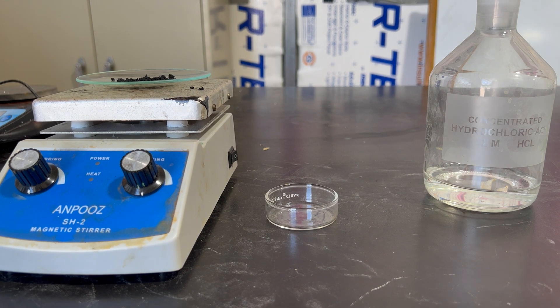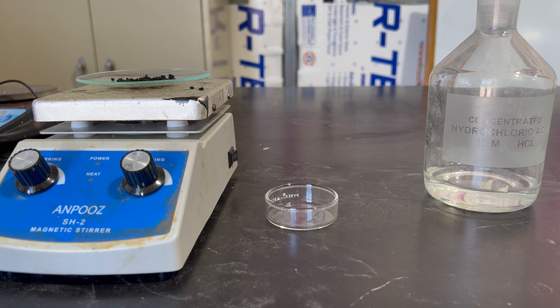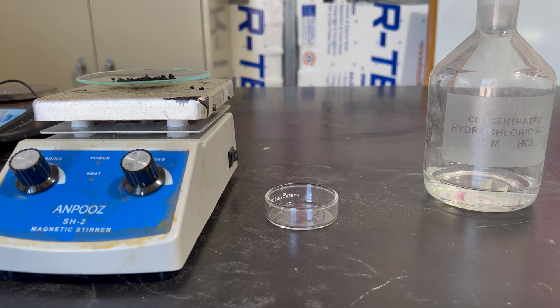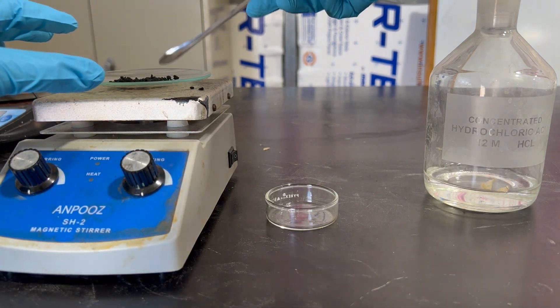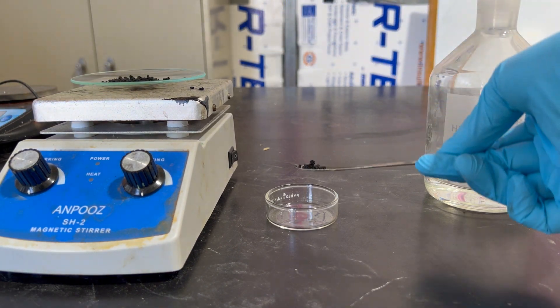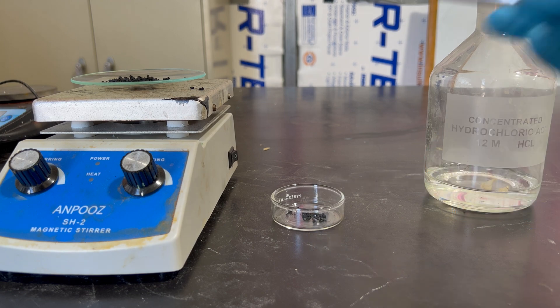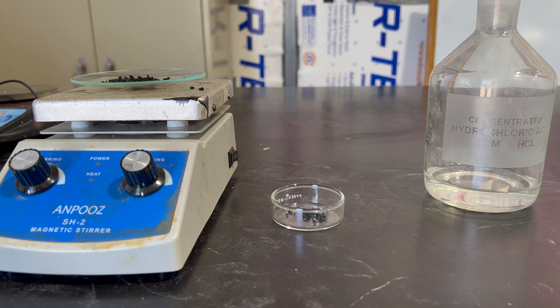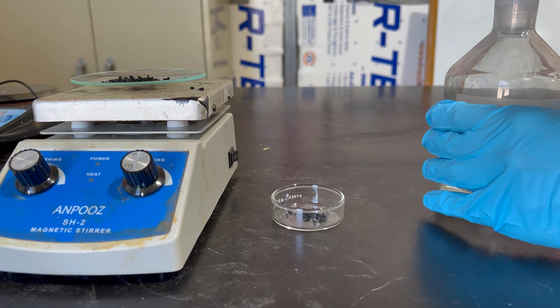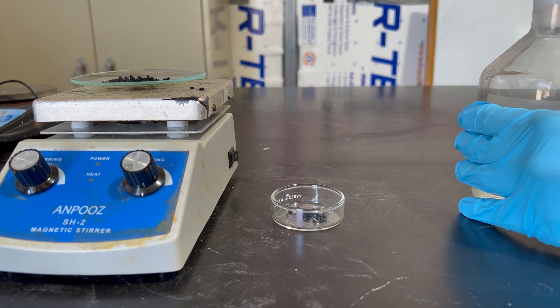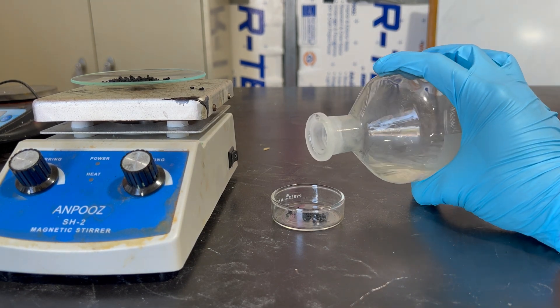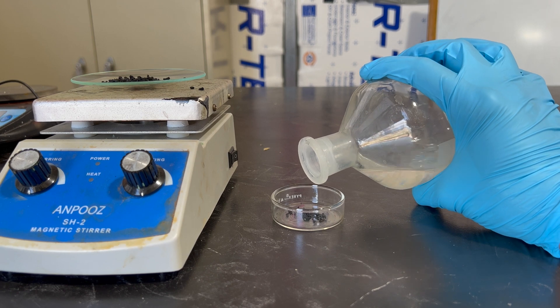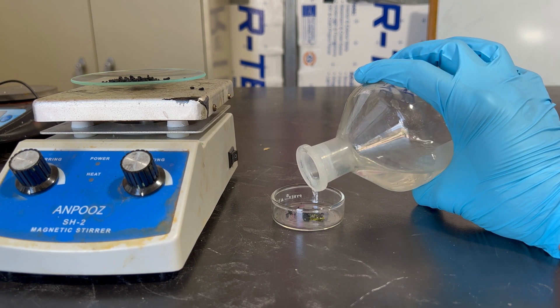Now that we formed the copper oxide and let it cool now and dry, we will now combine it with hydrochloric acid to form back into copper chloride. The reaction for this is copper oxide plus hydrochloric acid becomes copper chloride and H2O. Again, because in chemistry, just everything creates water, pretty much. We'll add a tiny bit of our copper oxide into that little evaporation dish, and then we'll start to add in the hydrochloric acid. You want to add this in slowly, just because it will get warm, so we'll add in a small amount to react with the copper oxide.